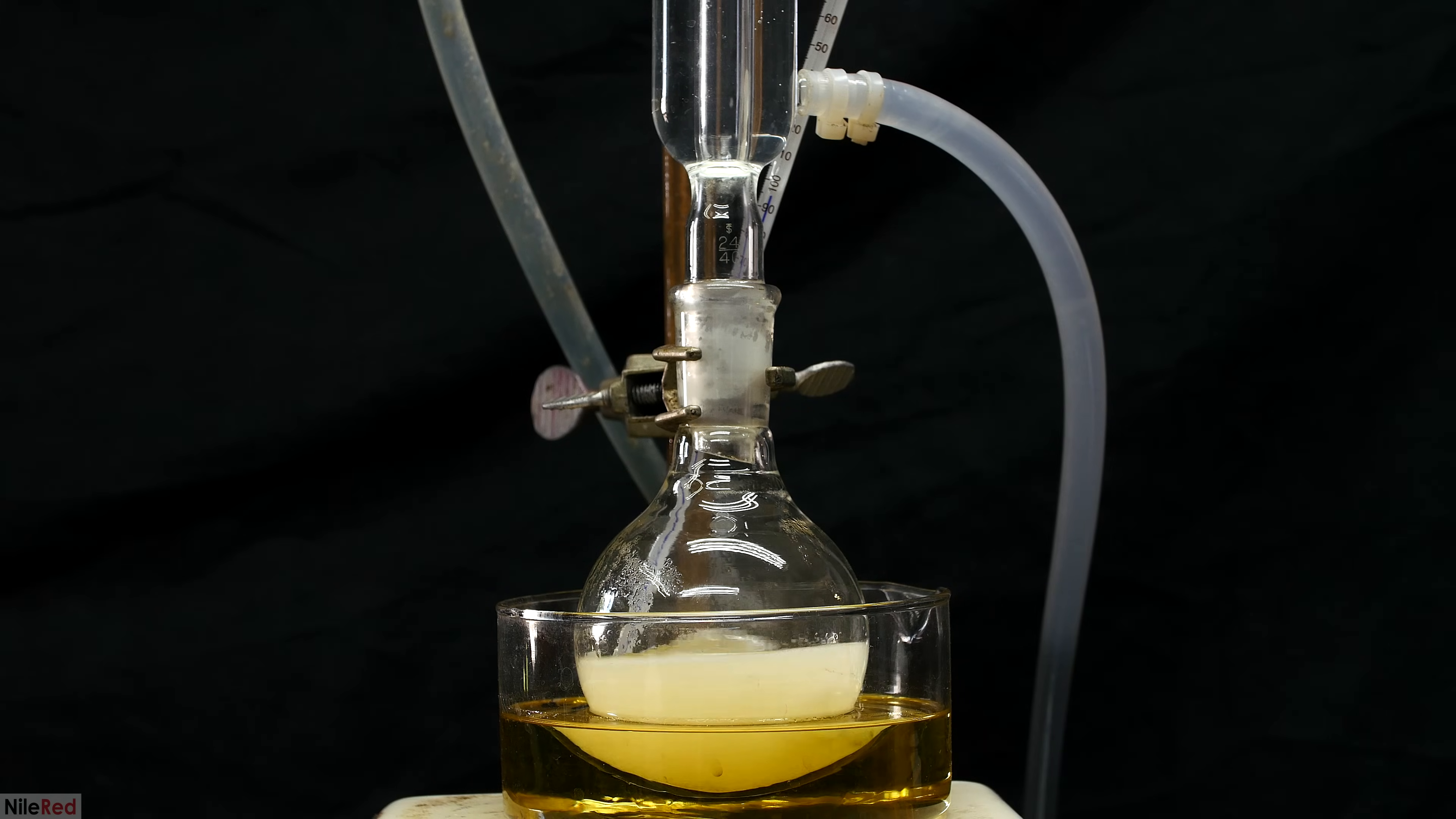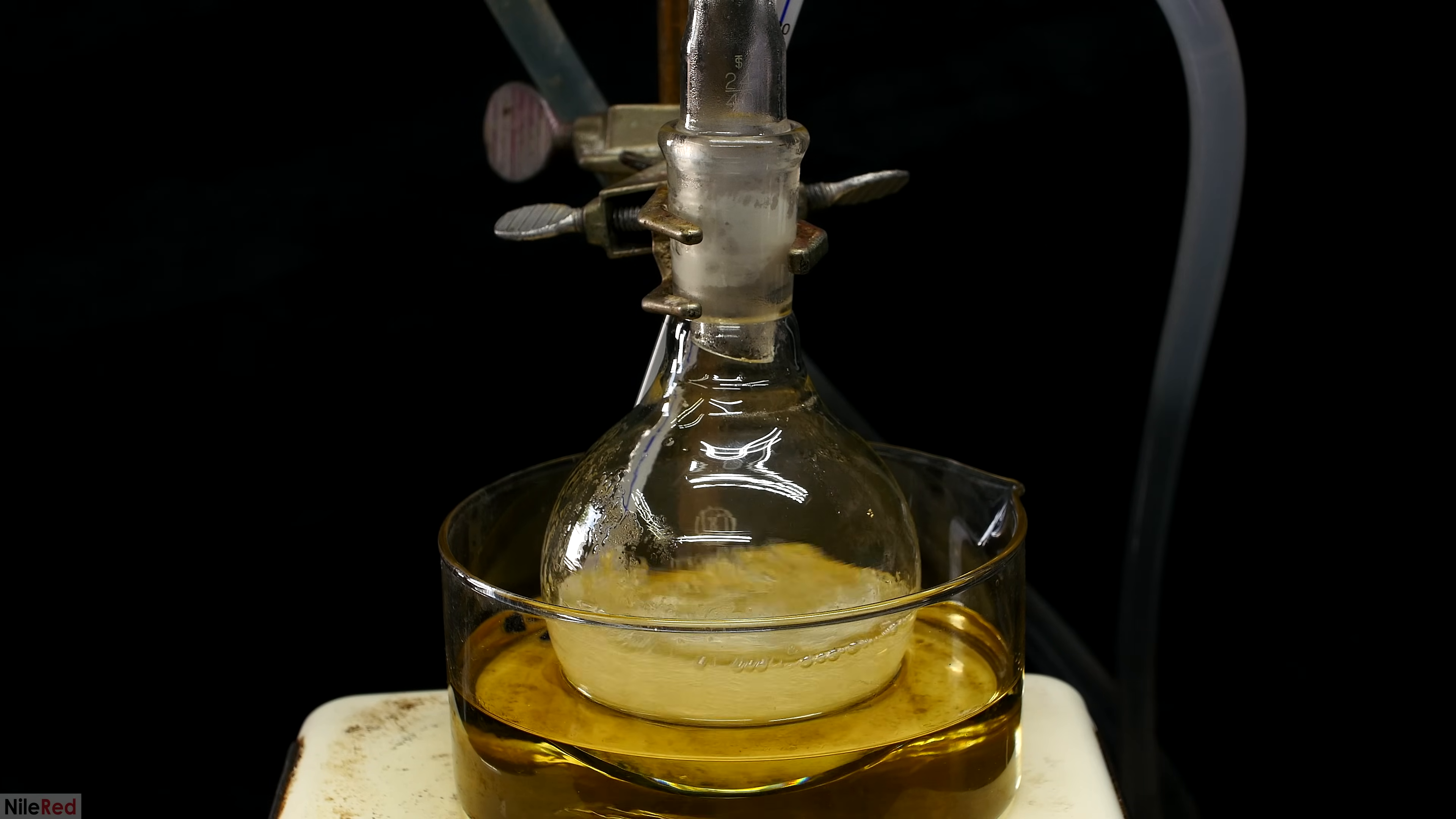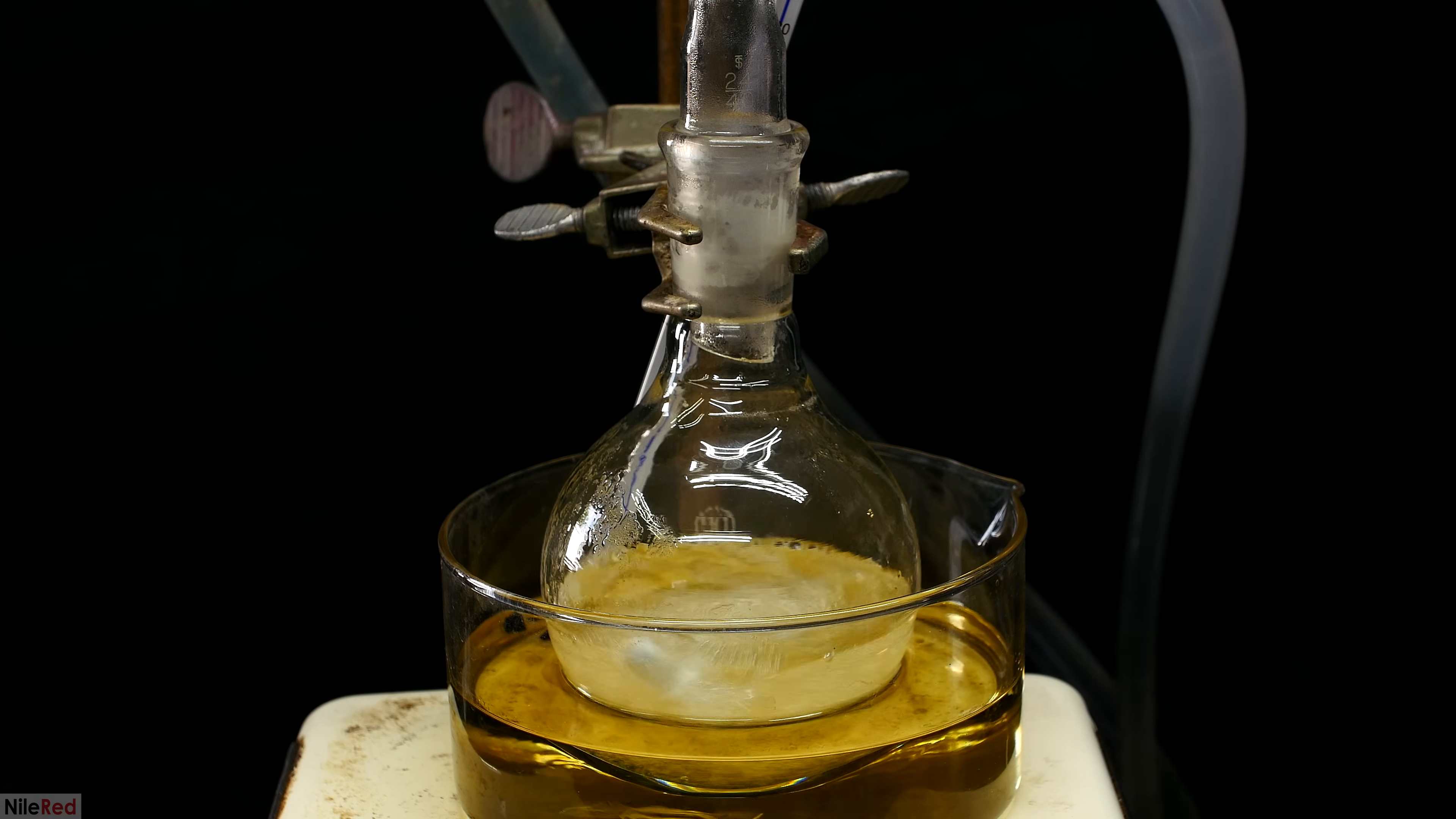Initially, before things are hot, we have a milky white solution with a bunch of chunks floating around in it. This is nothing to worry about though, because as we heat things up, everything will eventually dissolve.